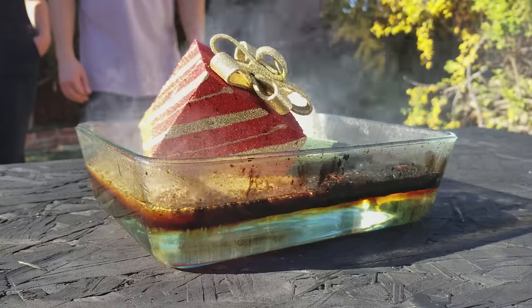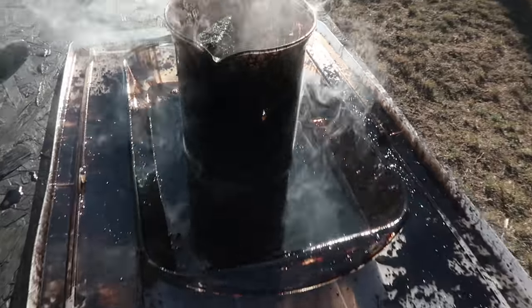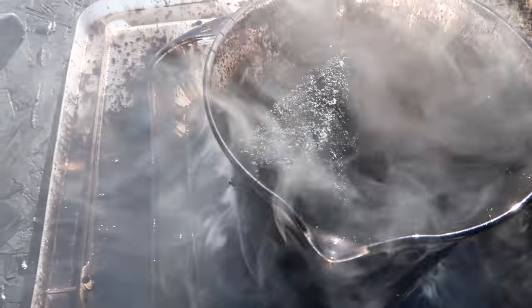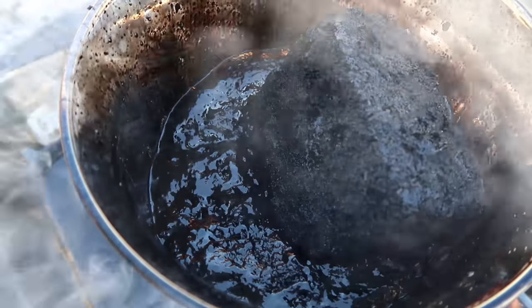What did you think? I thought it was definitely cooler than I expected. I expected it to kind of slowly eat away, kind of like with the styrofoam. But this thing just went and then it was gone — it was like the part where you go up on a rollercoaster, super accelerated and then it just dropped instantly. It was craziness. Is it technically baked now? I think it's double baked. It is still going! It's eating it!